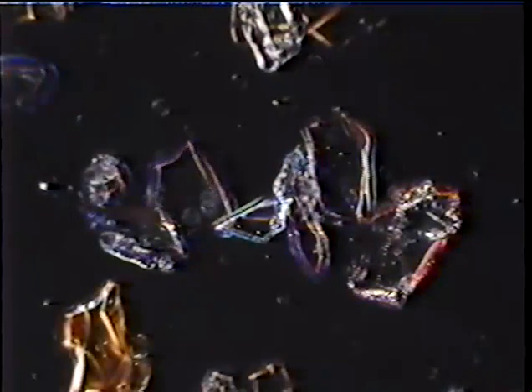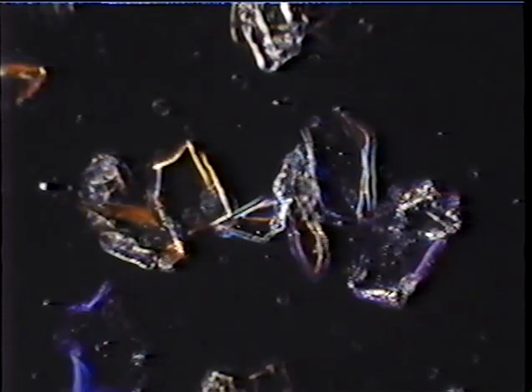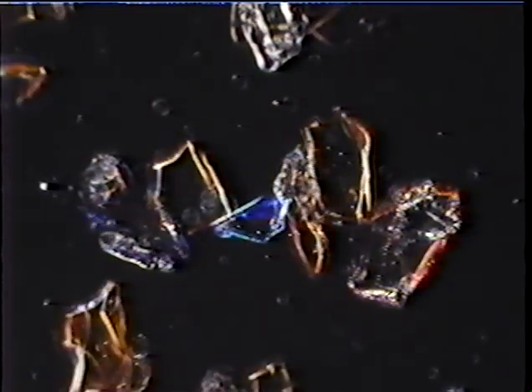This is a tape on chemical microscopy. The human eye is the best instrument and the most effective tool for chemical identification in the whole wide world. Every day you and I identify thousands of objects just by eye. A robin, a banana, a dollar bill, a door key, a ballpoint pen, any of thousands of objects.